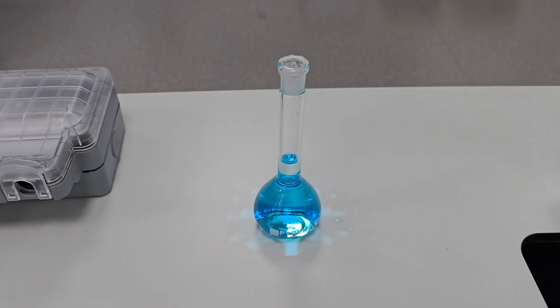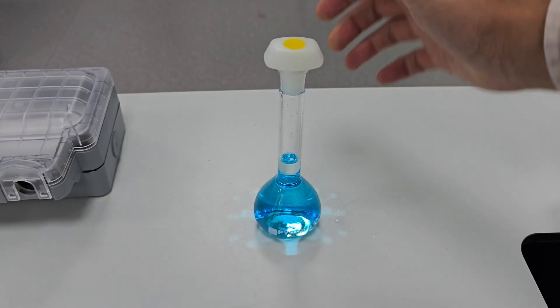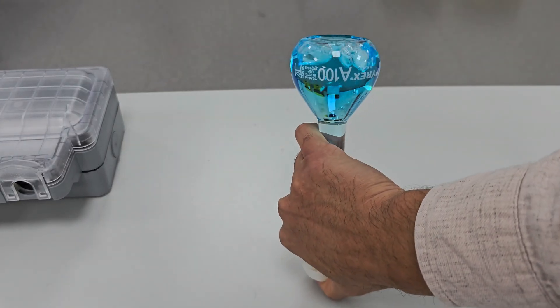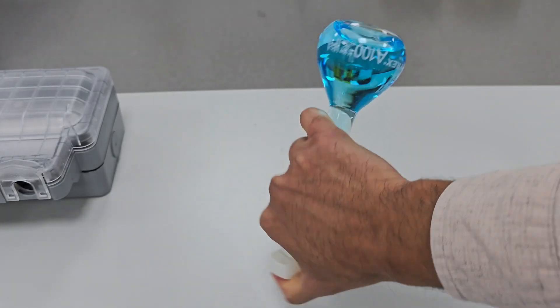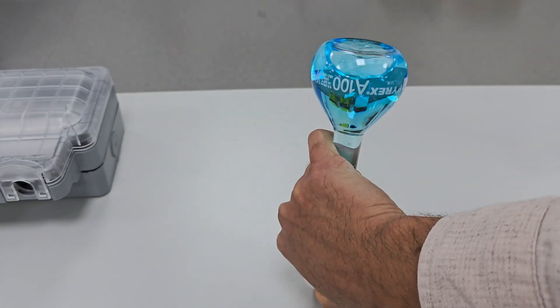Once the volume is correct, I put the stopper on the flask and invert it several times. This step is crucial to ensure the solution is homogeneous, meaning that the concentration is the same throughout the flask.